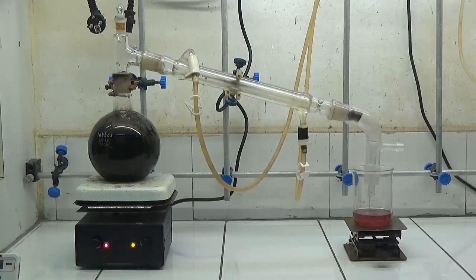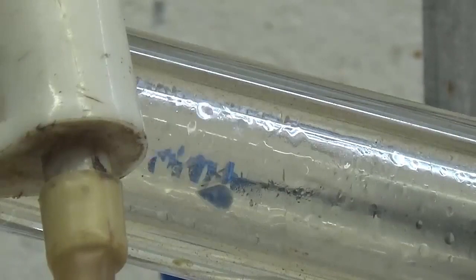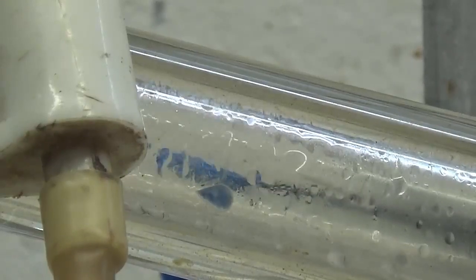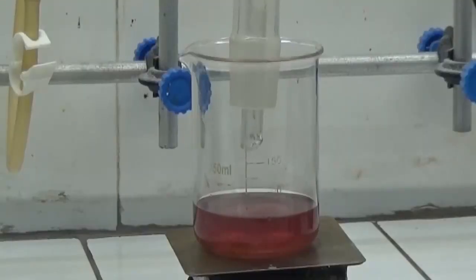After the hour of reflux and without allowing it to cool, set up a simple distillation unit and distill 200 milliliters of product. We made five operations of collection of 1000 milliliters of distillate.